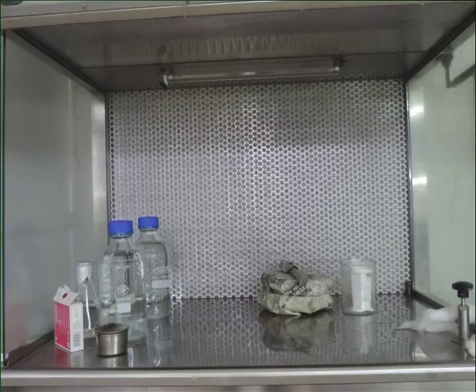First, place the plant material still in the surface sterilizing container, the containers of sterile water, the sterilized forceps and blades, and tubes containing sterile medium in the sterile workbench of the laminar flow cabinet after cleaning them with 70% alcohol. The gloves are also sprayed with a 70% alcohol solution and hands are rubbed together to spread the alcohol prior to placing hands into the chamber.